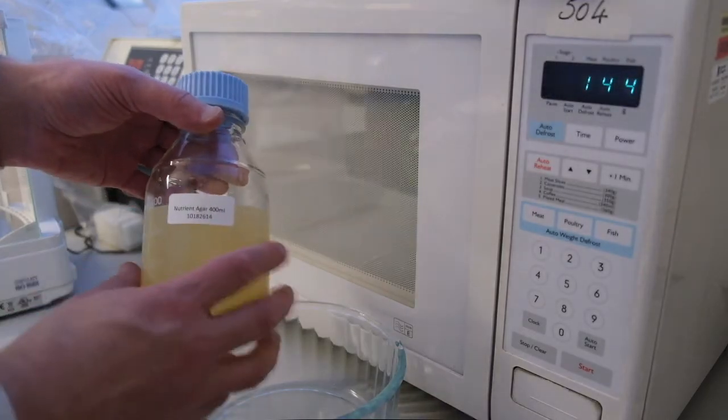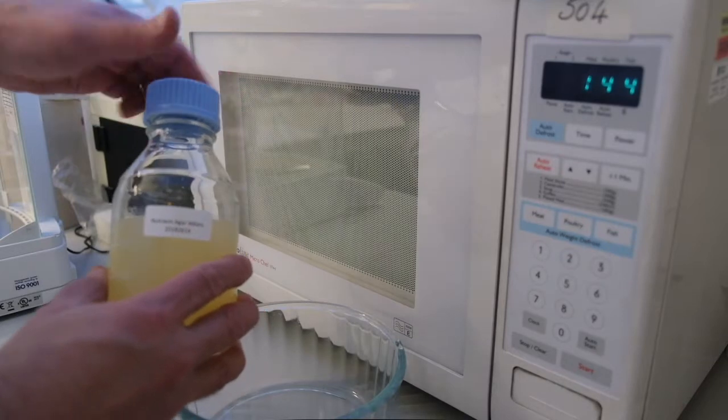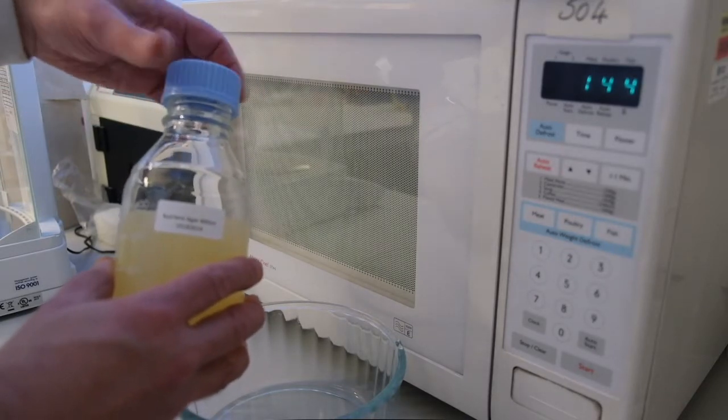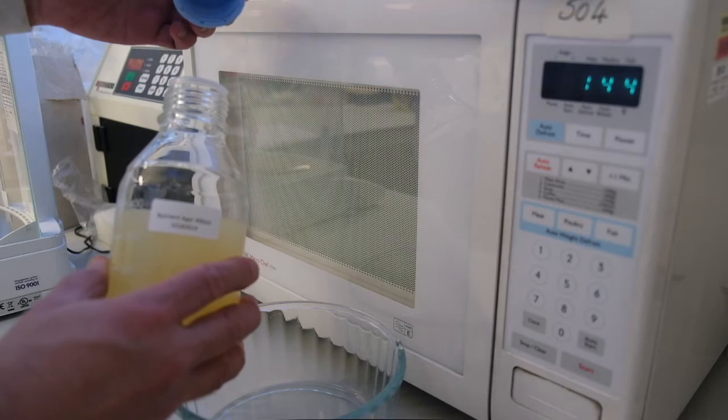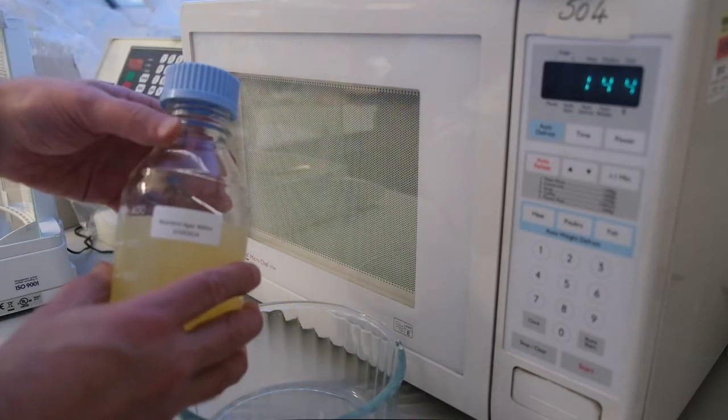We need to melt the agar in the microwave. First, loosen the lid to stop your bottle from exploding. This is very important. Leave the lid on loosely.